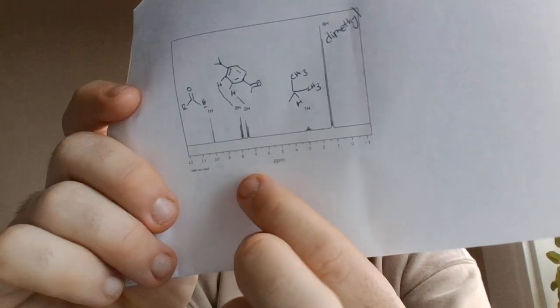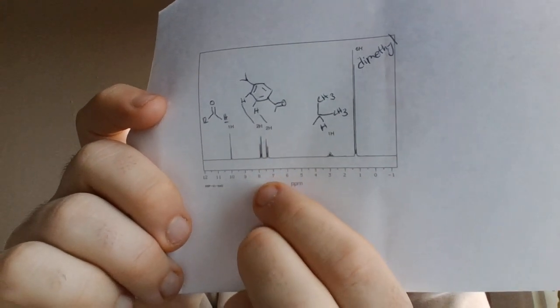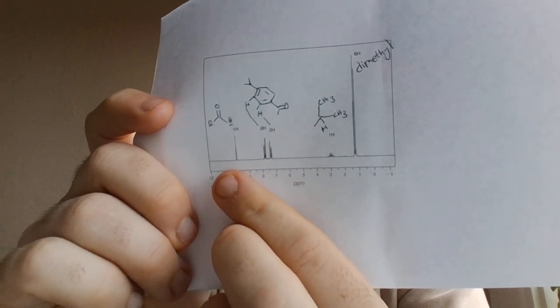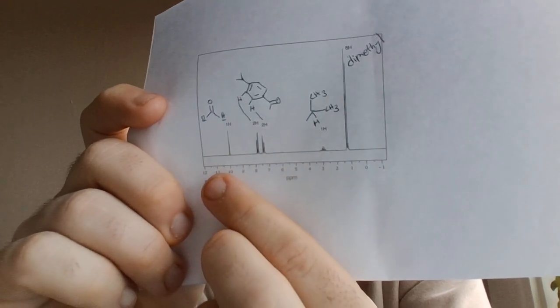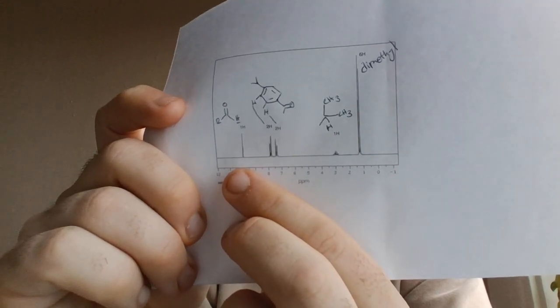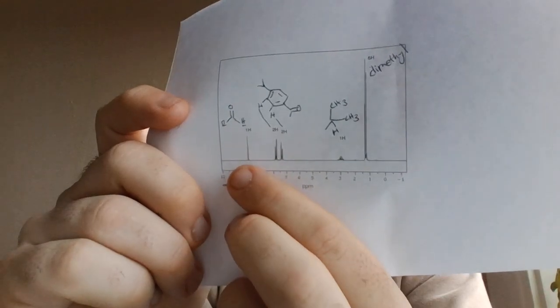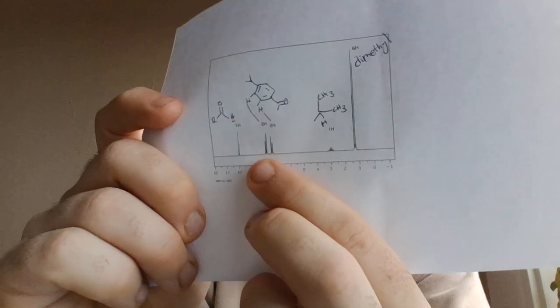We don't count the other ones coming off the other side of the benzene ring because of the symmetry, the line of symmetry for this structure. So we only count those 2 protons on the benzene ring. And then the final proton counted is the one on the aldehyde group, H1 integration, singlet multiplicity. These are doublets.